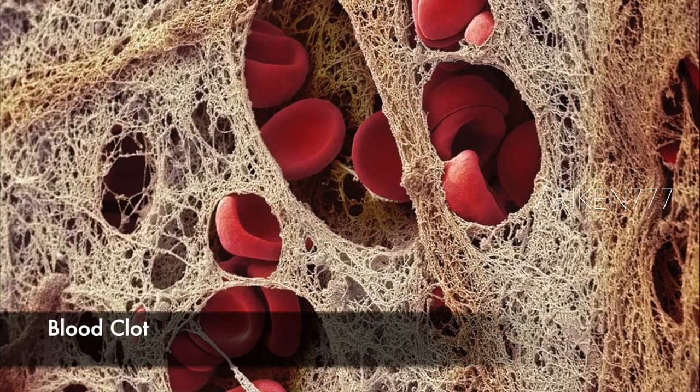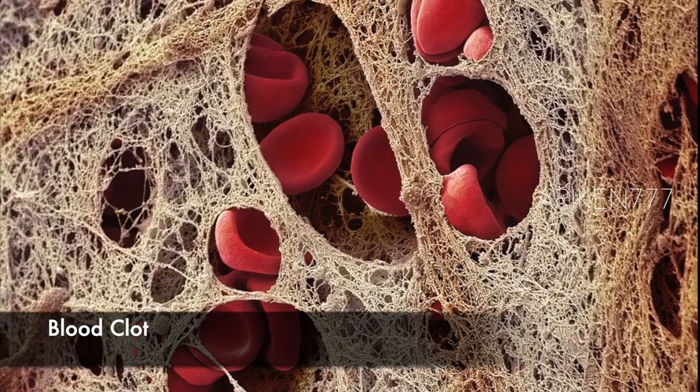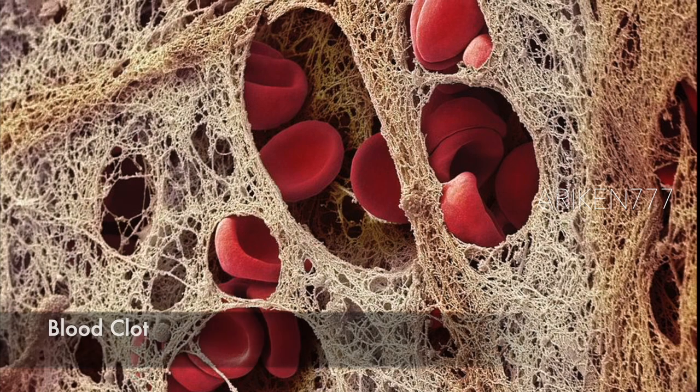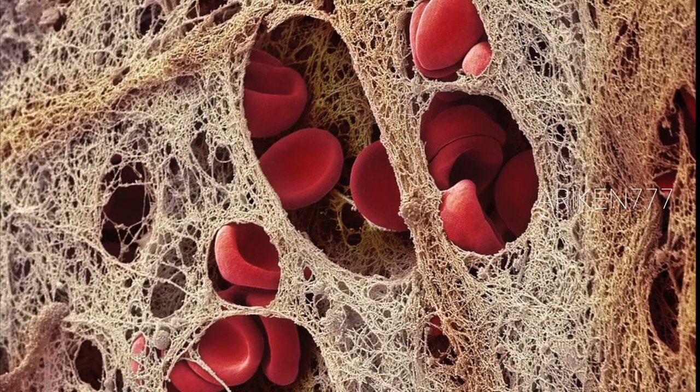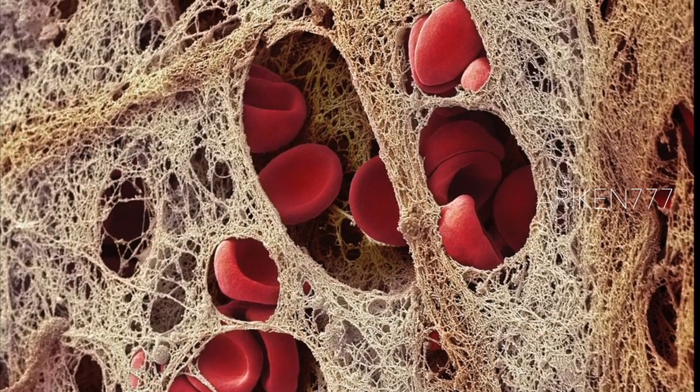A coronary blood clot. A blood clot in the coronary artery showing red blood cells in a fibrin mesh.